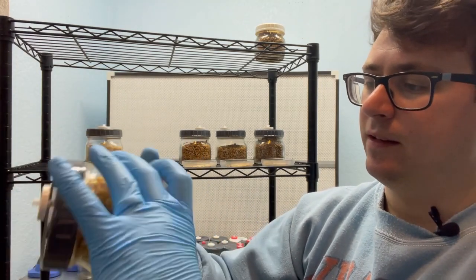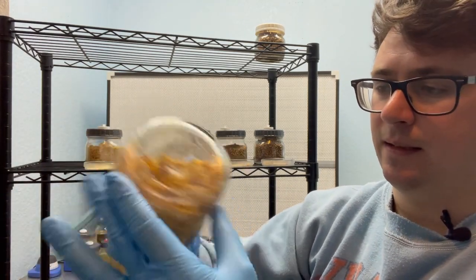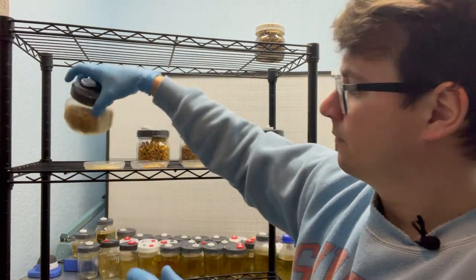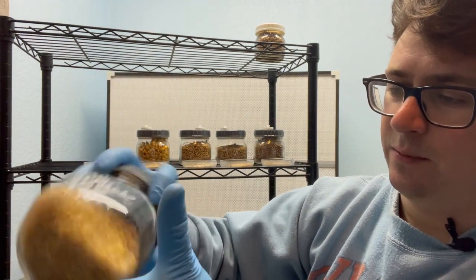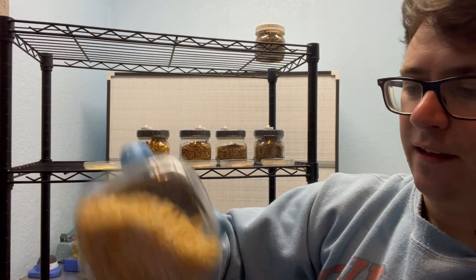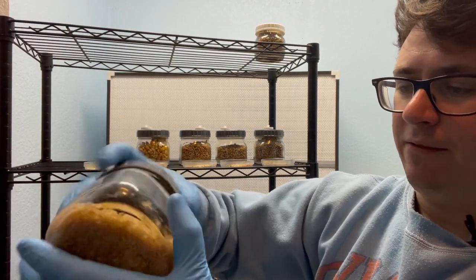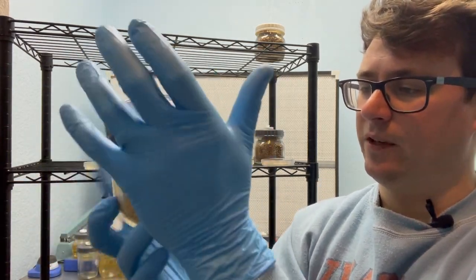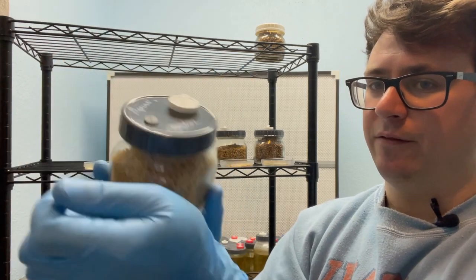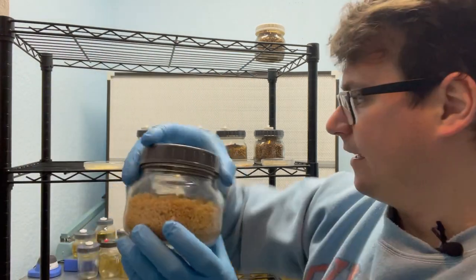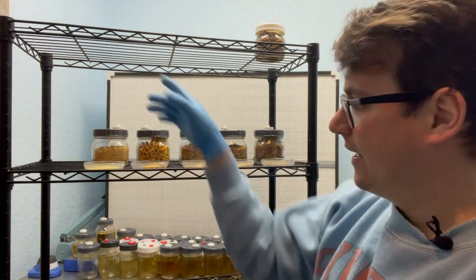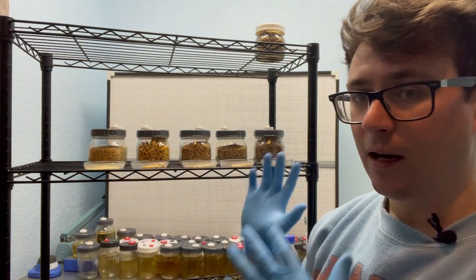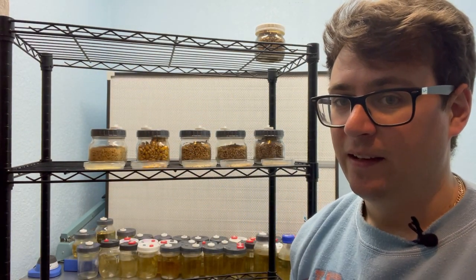The popcorn seems to be mixing up really nicely and now for the millet which is really kind of clumped together but I have a feeling that with the amount of inoculation points this one is going to make some really nice spawn for the bulk substrate. That was my mixing day, it's Thursday. I should be able to put these into our bulk production by early next week. Much love.